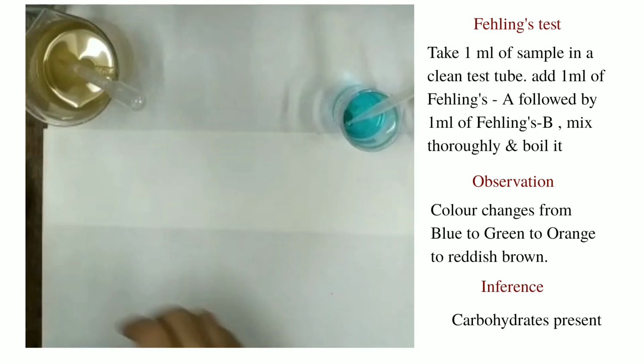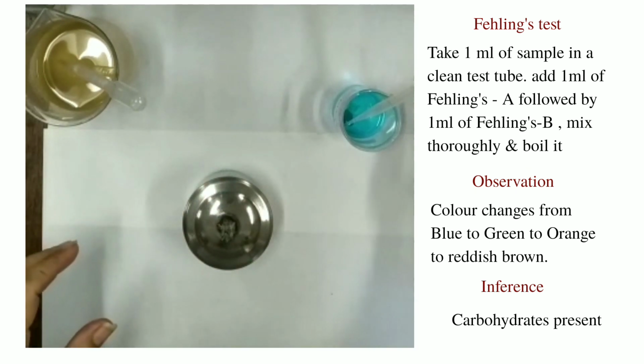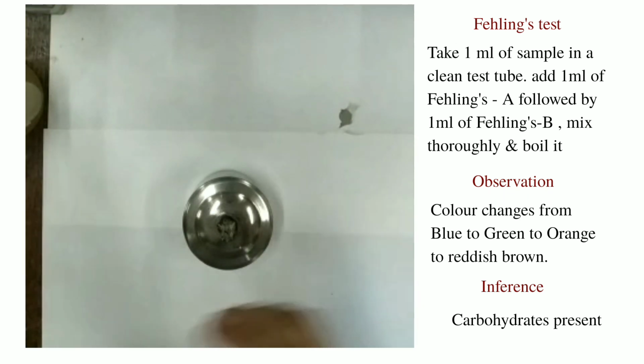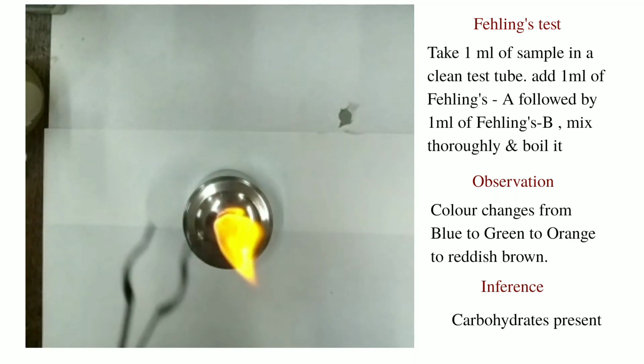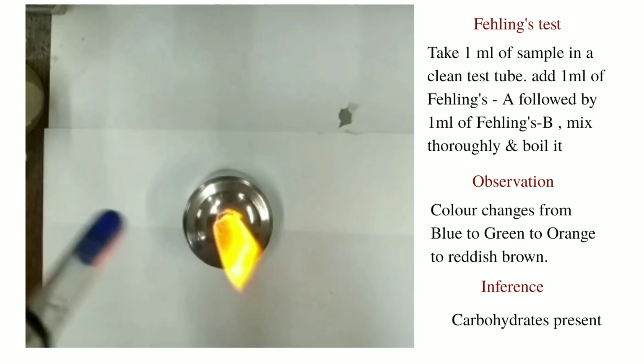We have to boil it. Take the spirit lamp. We will remove the reagents from here, and light it. Take the test tube holder and hold the test tube tightly.